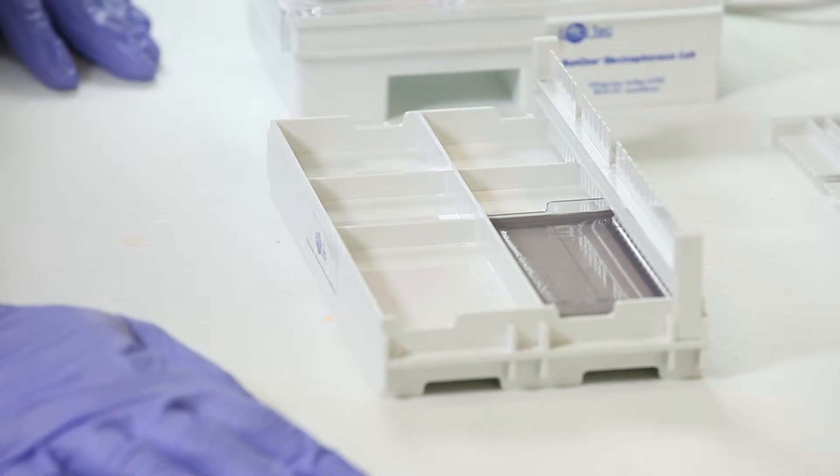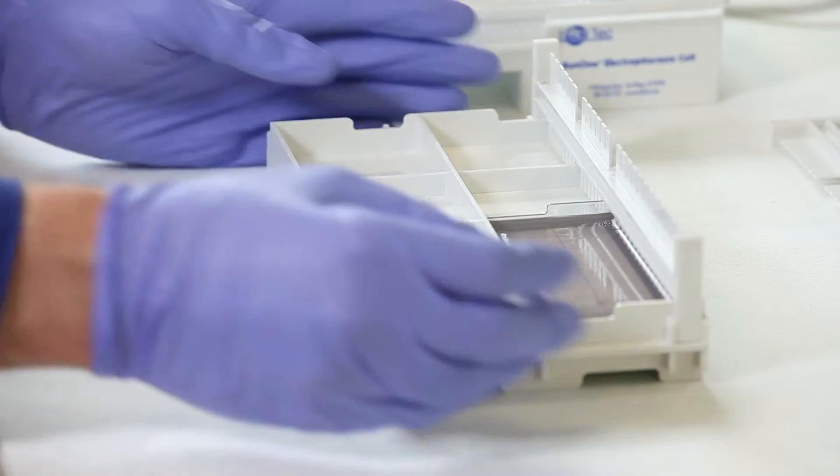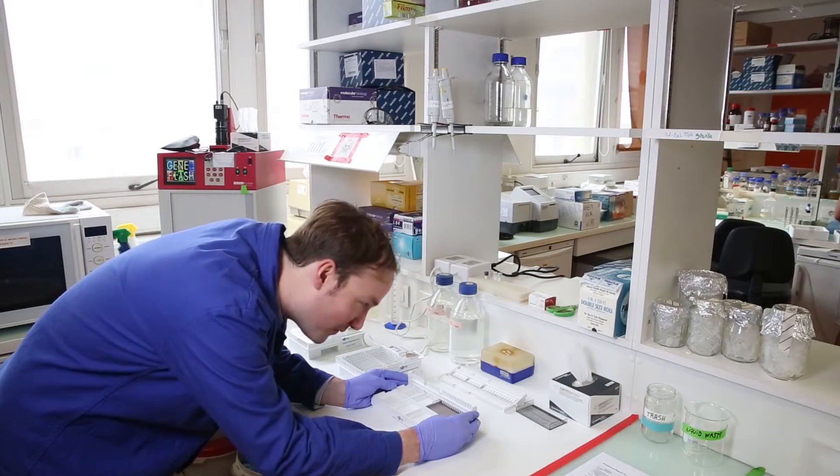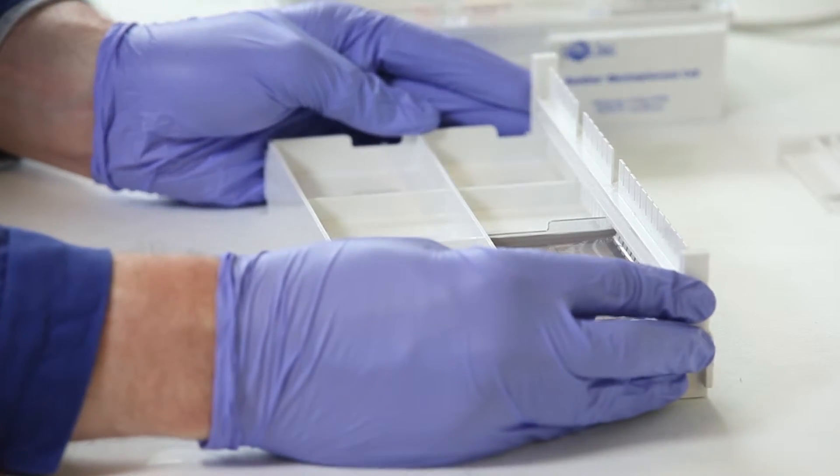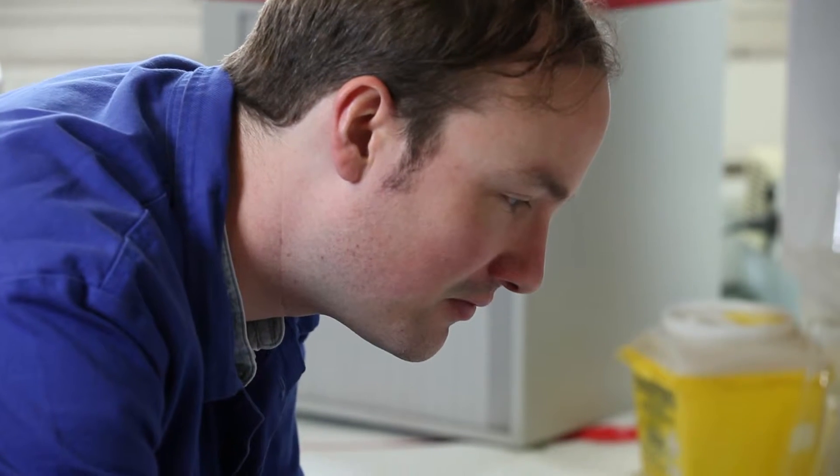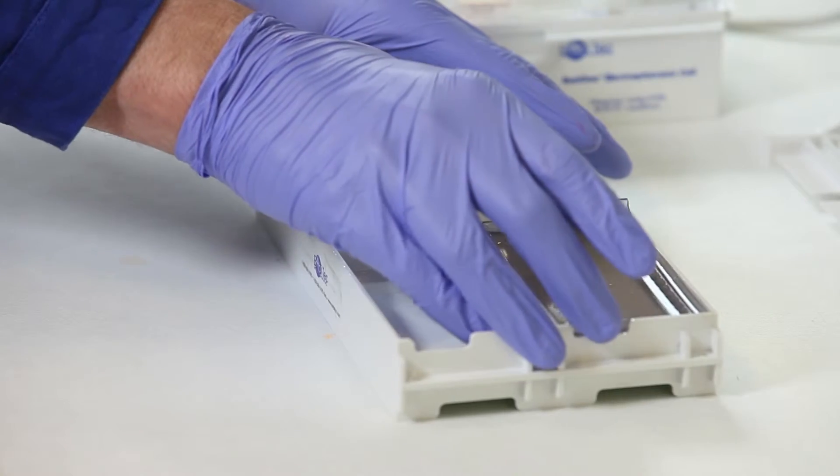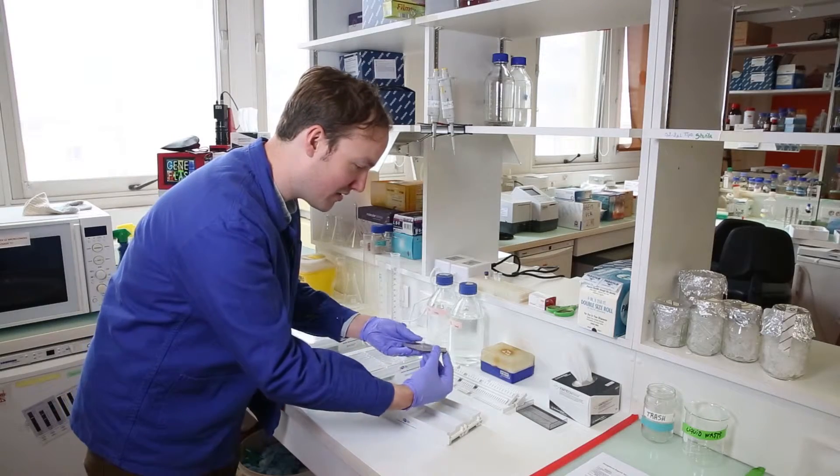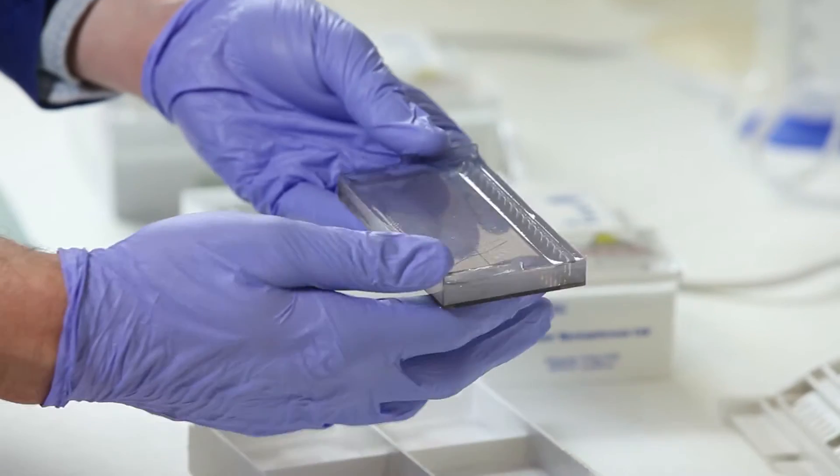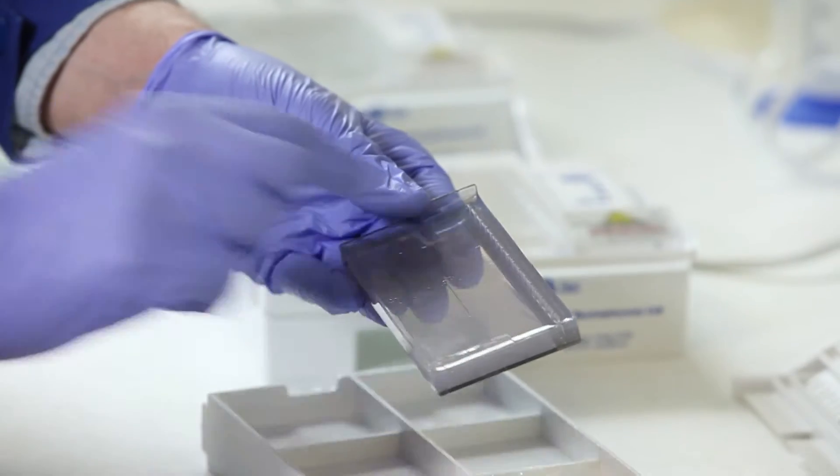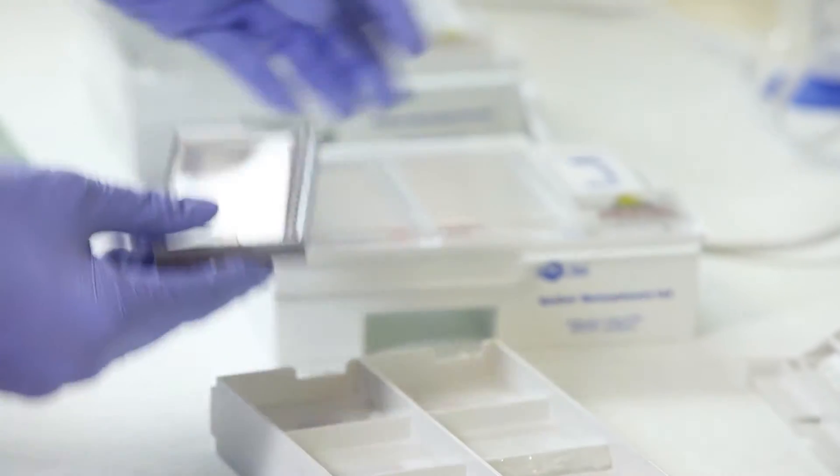Now the moment of truth. We very carefully pull the comb out of the gel and voila. We've got a perfectly formed agarose gel, nice smooth gel with perfectly formed wells for loading our DNA. Now that goes into the buffer, TBE, exactly the same composition as we used to make the gel.